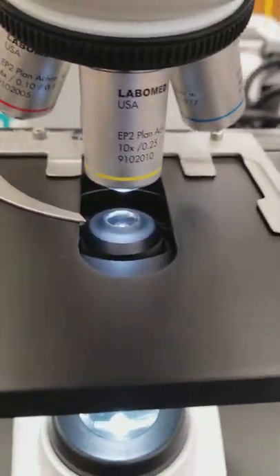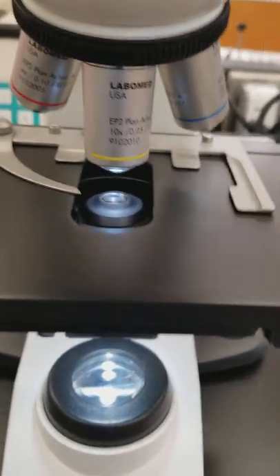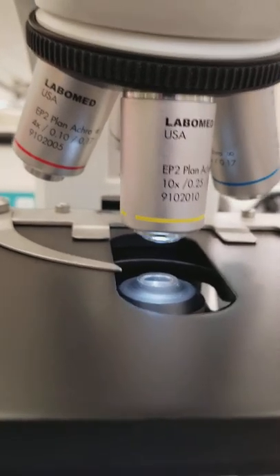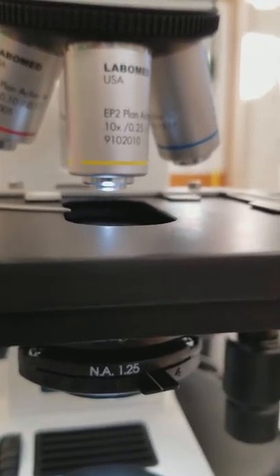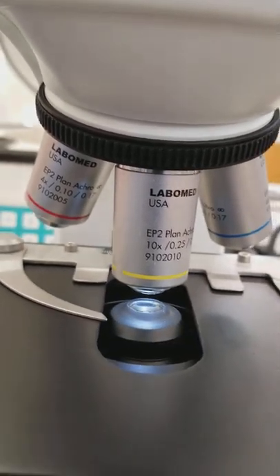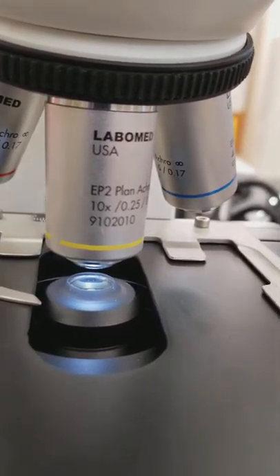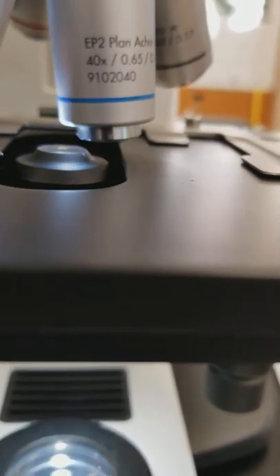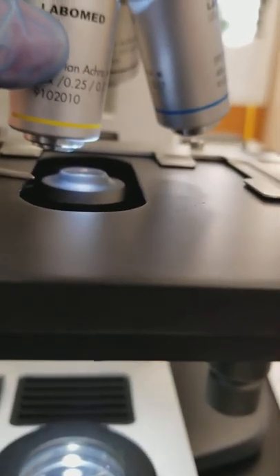Students end up having had the condenser way up. This is where your condenser honestly should be - notice it is below the level of the stage. But I notice that students have it up like this, which is not good because if I have any other lens objective, it's going to come and knock there.